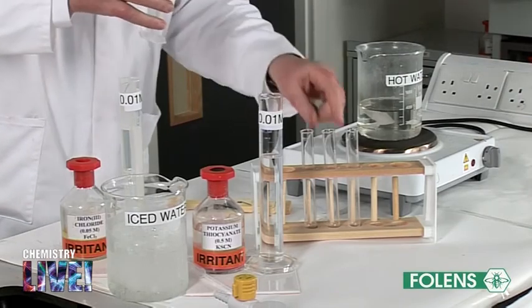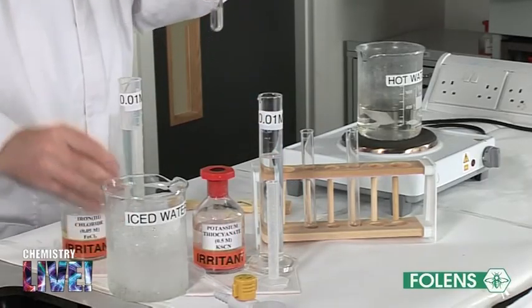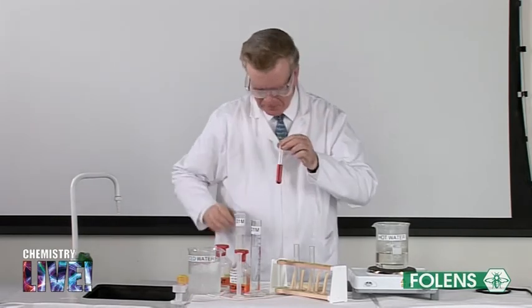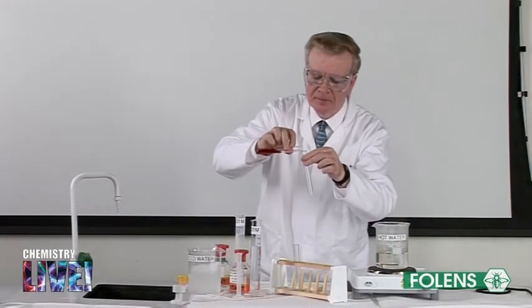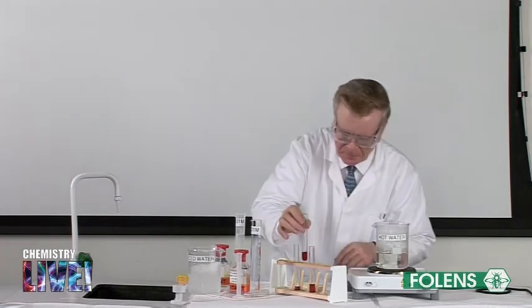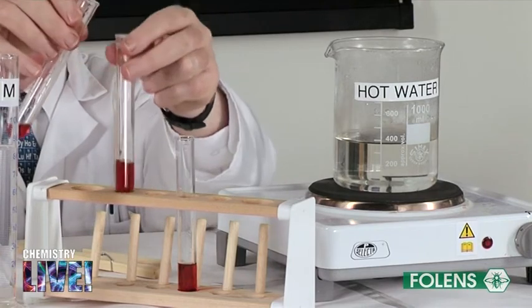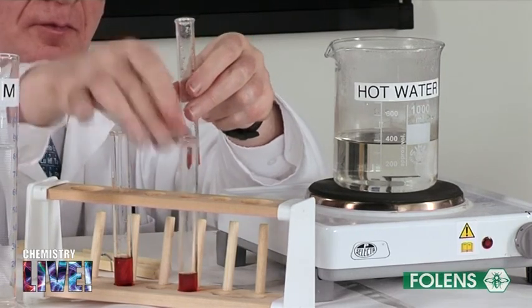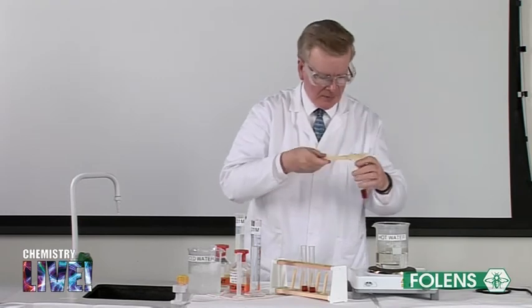Mix together about 5 cm³ of the diluted solutions of iron(III) chloride and 5 cm³ of potassium thiocyanate in a test tube. Note the appearance of the red colour. Divide the solution among 3 test tubes and place one in hot water, one in ice, and leave the third at room temperature.